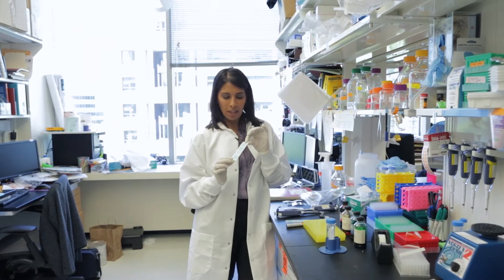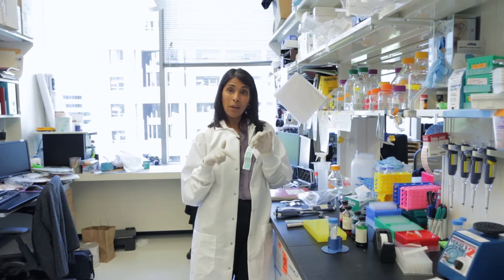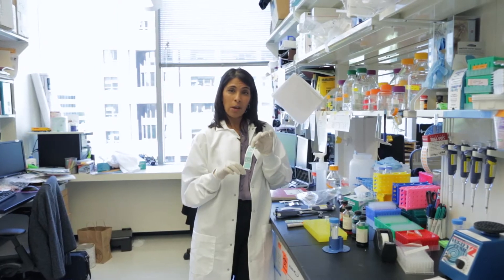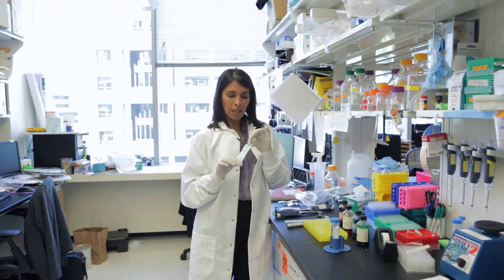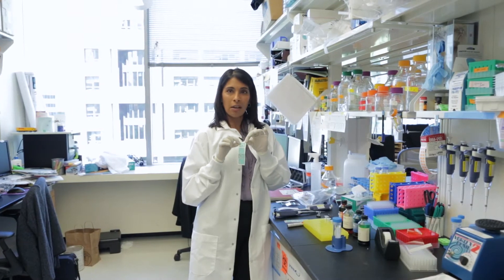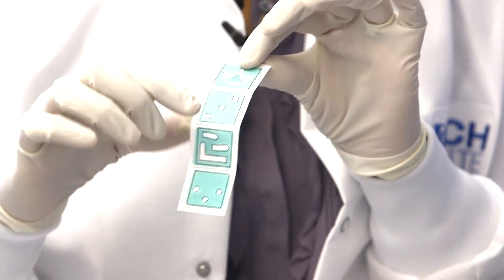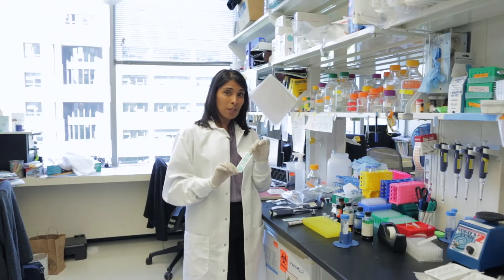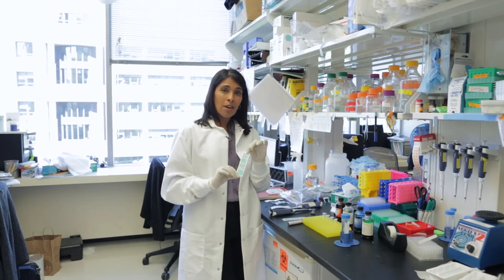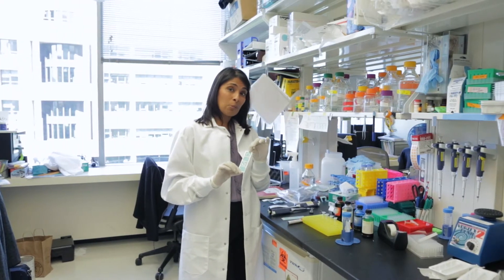What I'd like to show you is the way that you can create fluidic networks in this structure by folding it up and allowing different colors that start here on this structure to end up coloring this object at the end, which in this case is a crown. These kinds of paper microfluidics are the ones that we use in our paper diagnostics projects for fluid samples of patients.